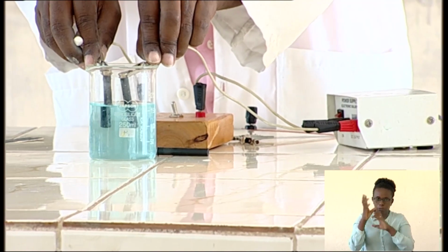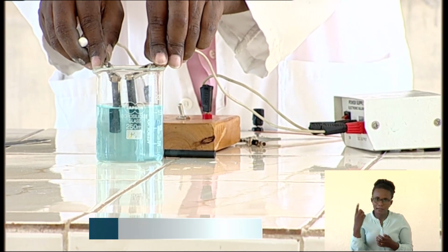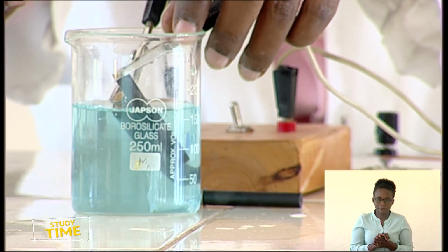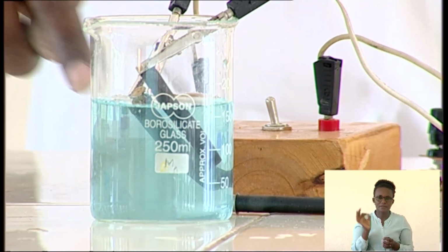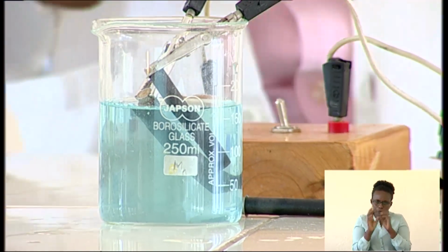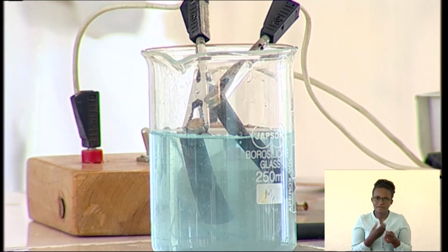I'm just going to remove them from the solution and see. Also on this, we see some bubbles coming up. Let me just put it back. But what is on this? We can leave them there for some time. When you look into the solution, this solution was pure, but we see some other things coming in. Some spots which look black. You see, the solution is no longer pure. There are some things coming in there. So what could those be?